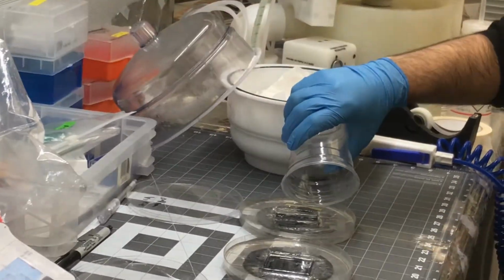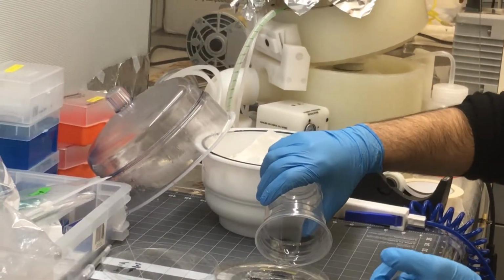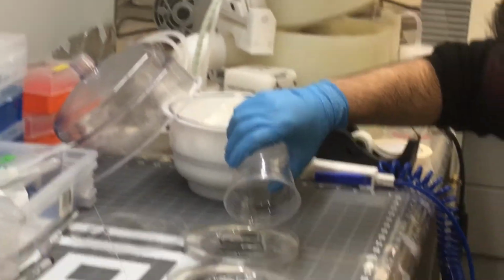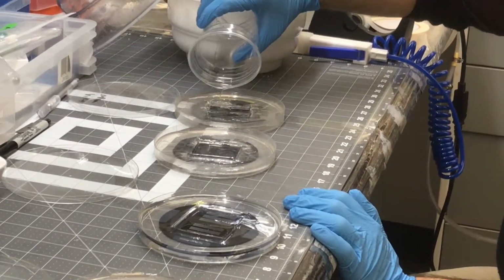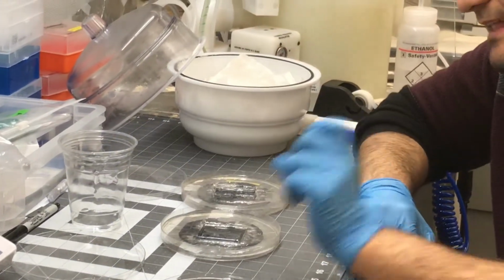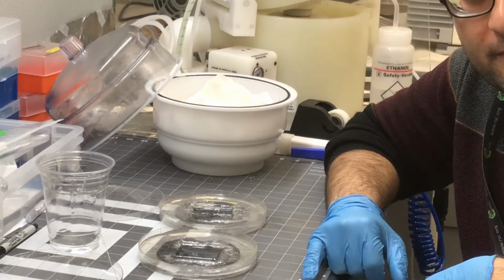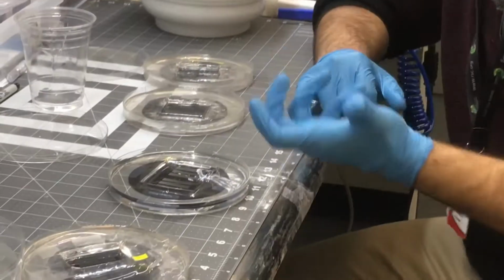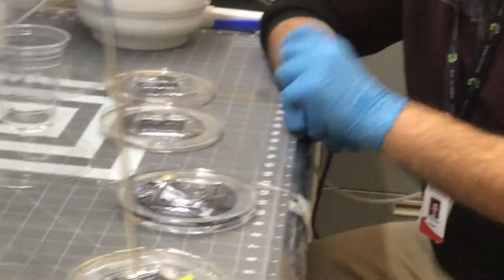So if your chip is 5 millimeter, yes, 5 mil. We fill the whole area to around 10 millimeter, so that half of it is around 5 millimeter height. The other important point is, we need a chip whose height is balanced between thick and thin. If the height is too thick, we cannot see under the microscope. If it is too thin, you cannot handle it, because we need to attach it, for example, to other PDMS or a cover slip or something like that. You cannot handle it.